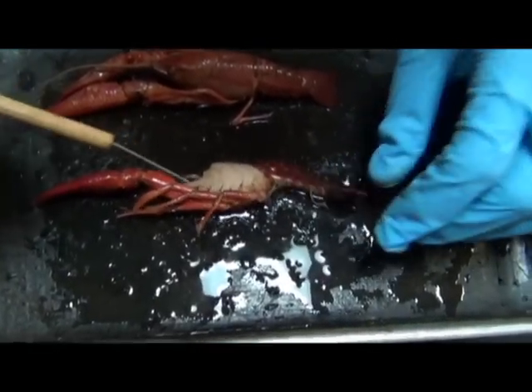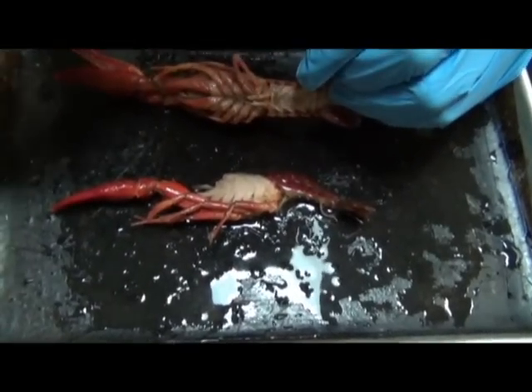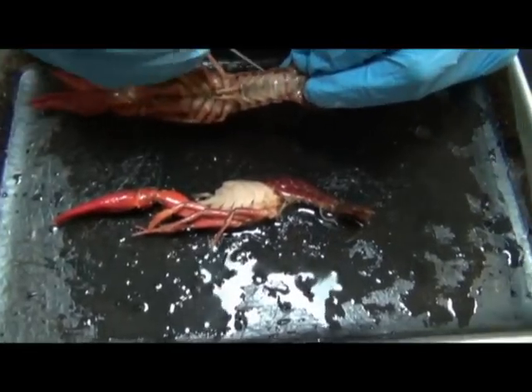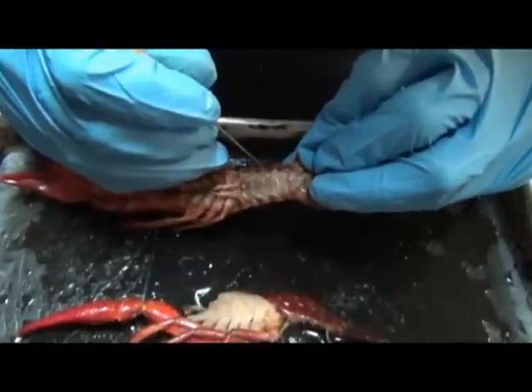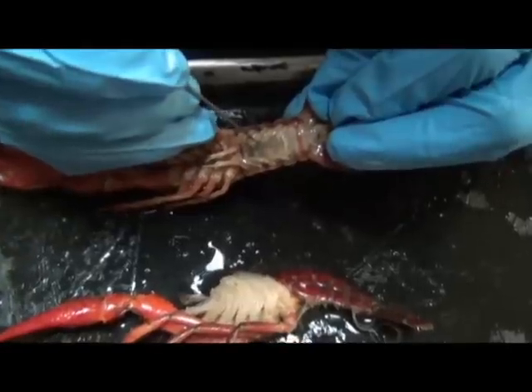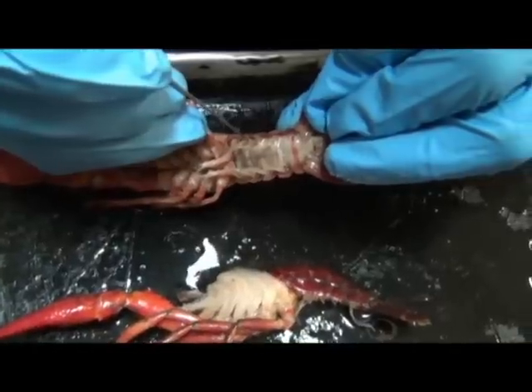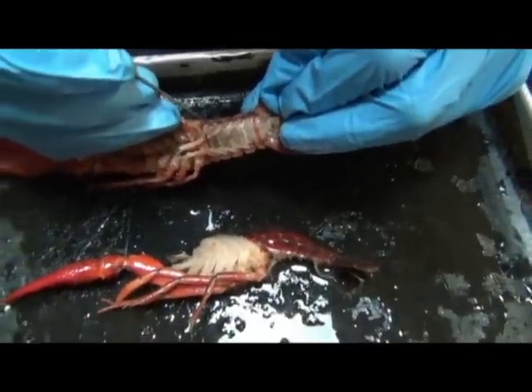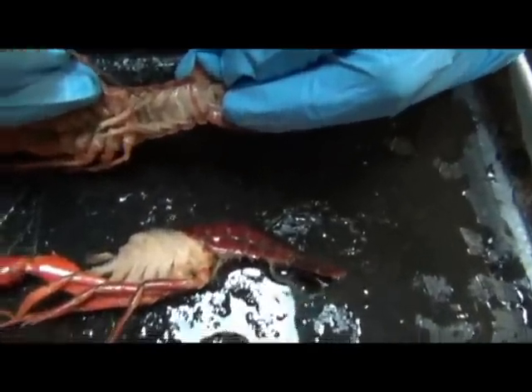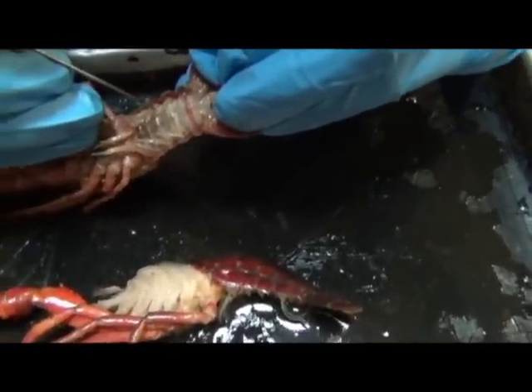Okay. If we were to actually look at other structures to verify that this animal has additional biramous appendages, take a look at one of the swimmerets. Okay, let's see if I can illustrate this. If you look at the base of the swimmeret, you have a paired structure. It's a little swimmeret. There's two. It's a biramous structure. Two appendages that come out from the same base.